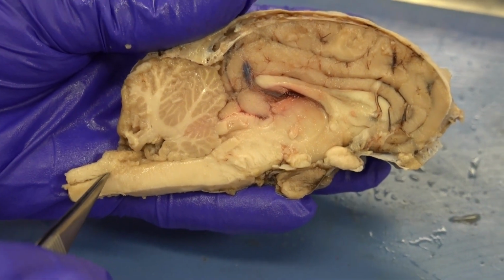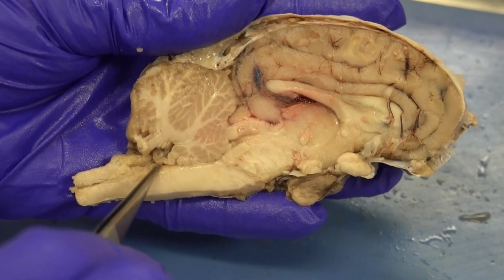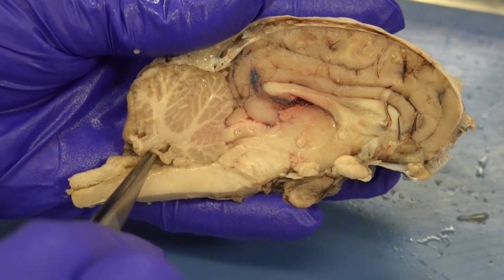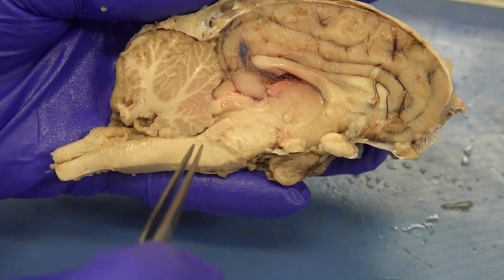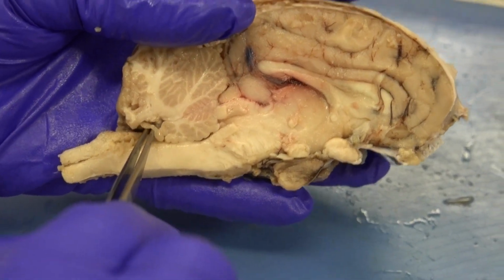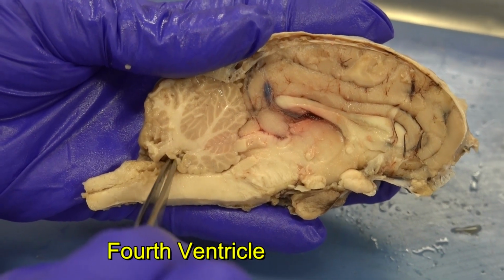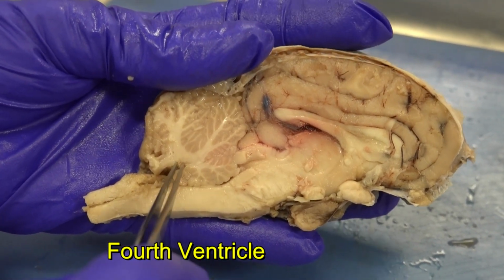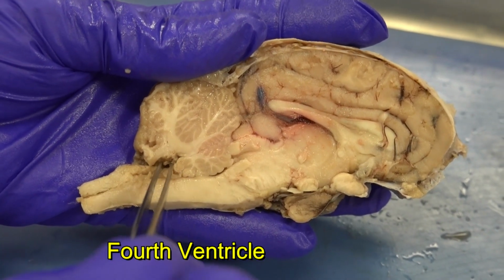And when I follow this, I can see that eventually I get into a triangular shaped space between the cerebellum, recall that I said cerebellum looked like a broccoli, and the brainstem. That would be one of our ventricles. We call this the fourth ventricle. So that's one of the places that we look also for cerebrospinal fluid.